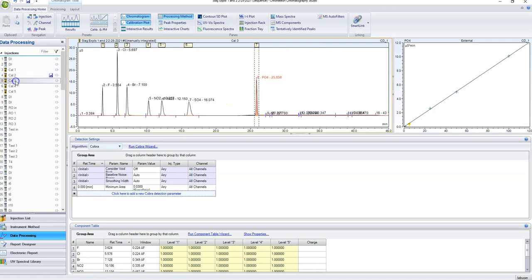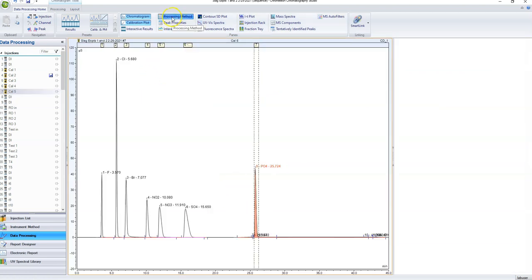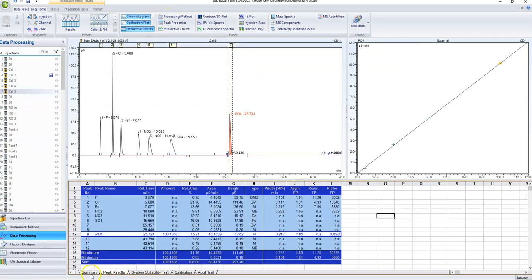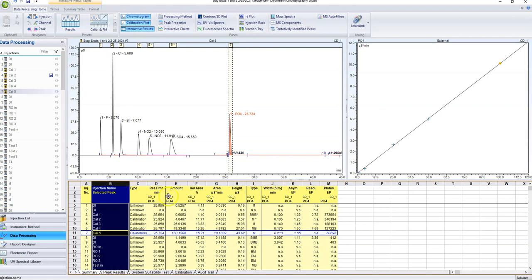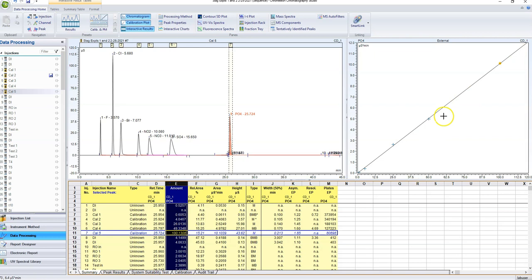That one looks good. That one looks good. All right, so now they all look good. And my calibration plot is very linear. So we're done with our processing method, at least for phosphate. And now we can open up interactive results. If I go to summary here, it's going to show me all of my samples. So my injection name, it's going to show me the area, and this amount is calculated using this calibration curve.